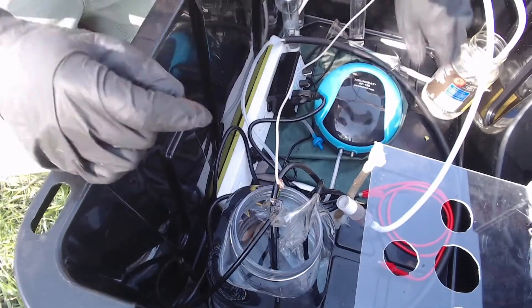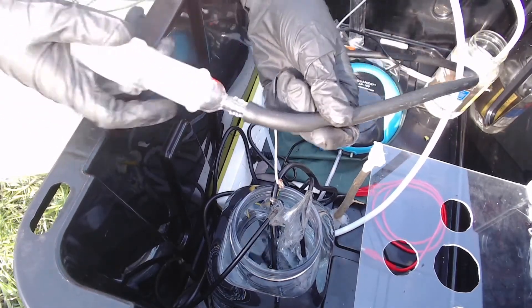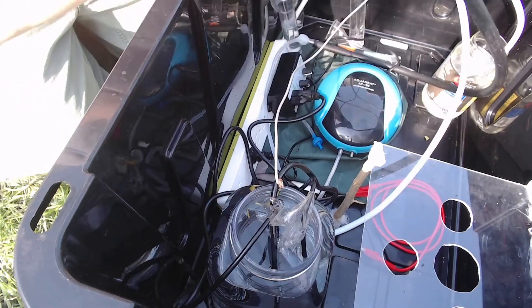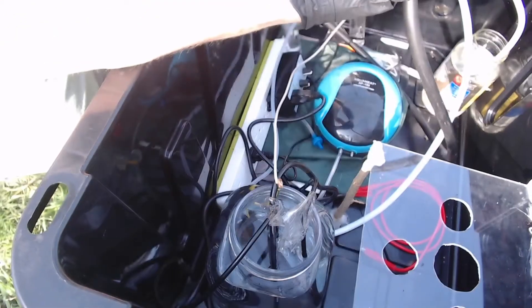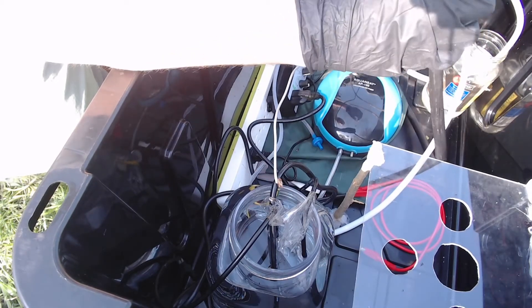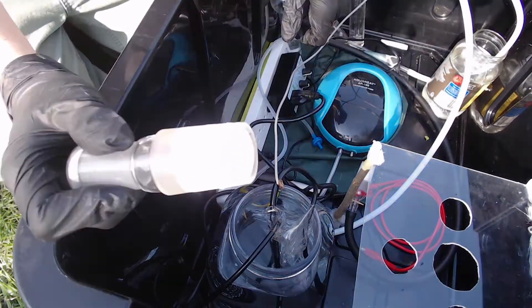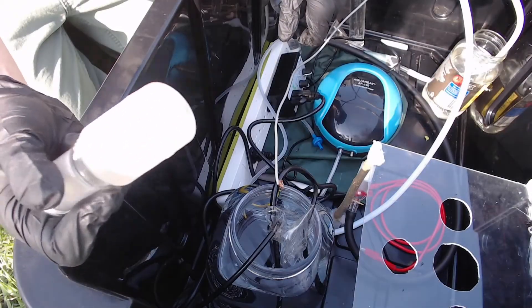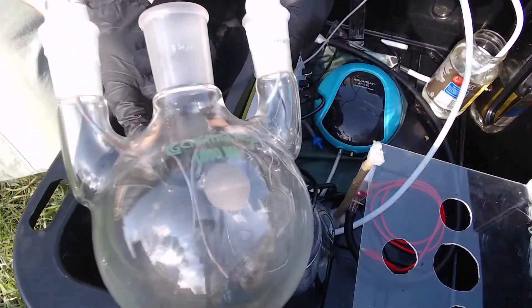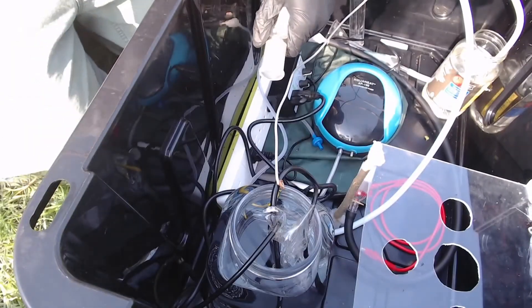There was a bit of an issue with the aquarium line not quite being big enough to attach to one of the inert gas adapters, so I ended up grabbing a little fuel line — worked pretty well. This is on the clean air intake side, so it shouldn't be too heavily exposed to the nitrates. There's also an adapter reducer piece to take us from 34/45 down to 24/40. I could have just gotten a four-neck 24/40 flask, but this one was a really good deal so I picked it up and bought an extra glass piece to make do.